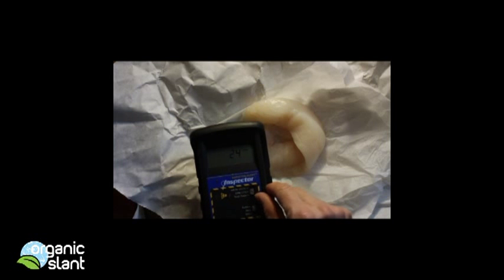Well, to be continued. I'll be testing more pieces in the future. Let me put it back up on this guy.